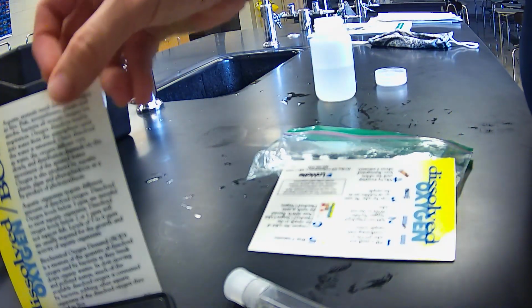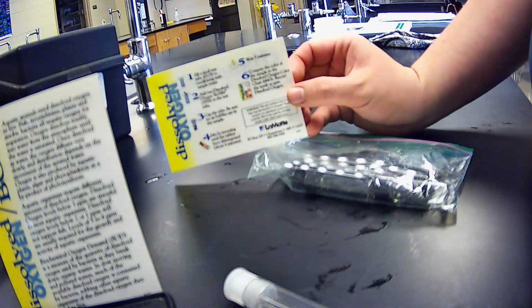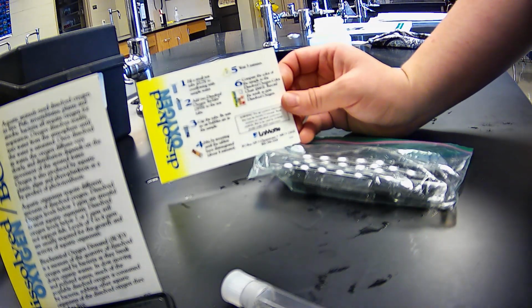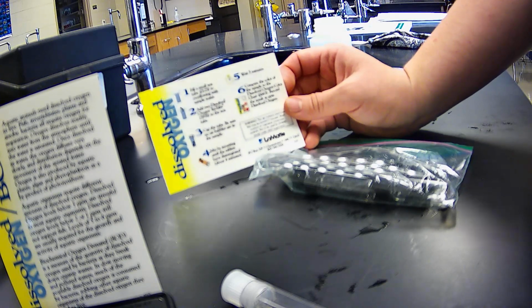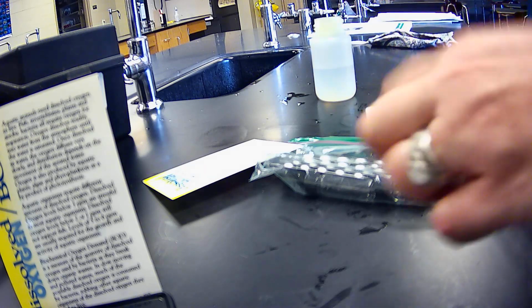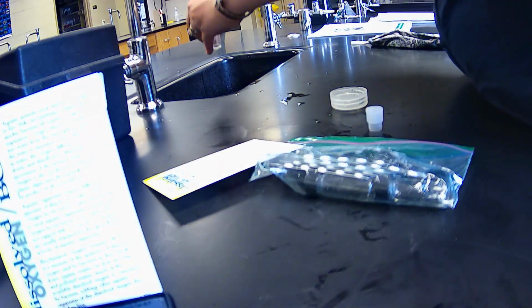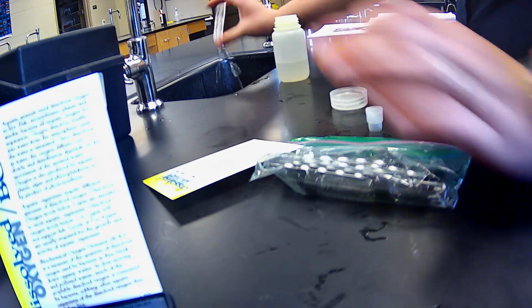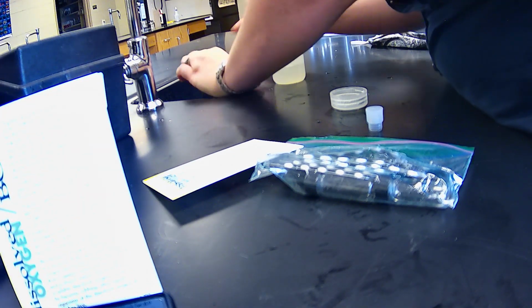So here's the information for dissolved oxygen. We are going to fill this test tube to overflowing with the water sample, and we're going to add dissolved oxygen test tabs to the test tube. Now, this would be ideal if we were out in the field and we could completely submerge this tube. I tried doing some videoing in the field, but I was having technology problems, so that's okay.